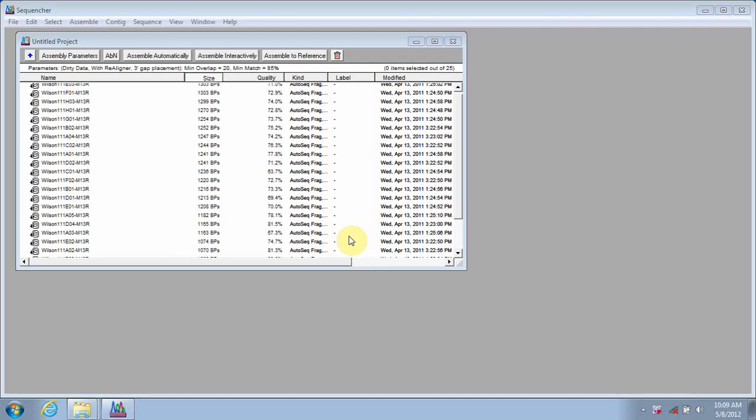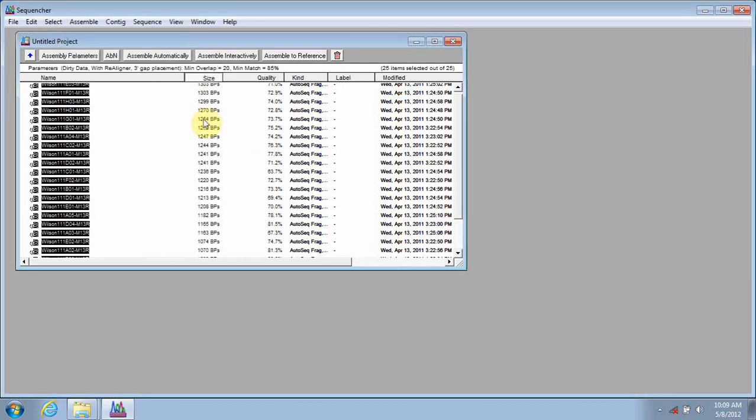Now I'd like to move into trimming within Sequencher. As with a lot of the data quality features within the program, you have a lot of choices. From the project overview screen, you can select all of your sequences. Remember, if you have a reference sequence and it's designated as such, you'll always be protected. Sequencher won't make any alterations to your reference sequence, so you don't have to worry about truncating it.